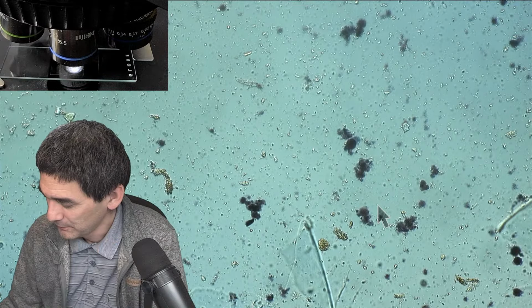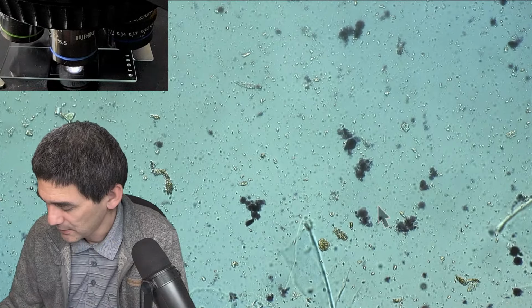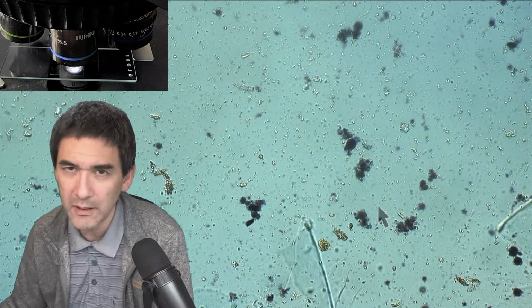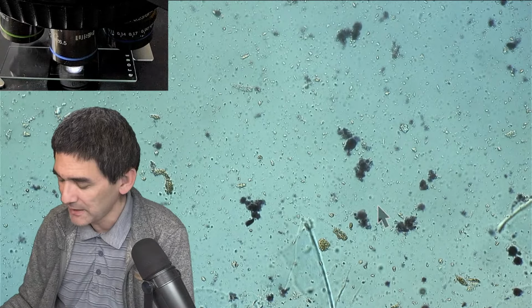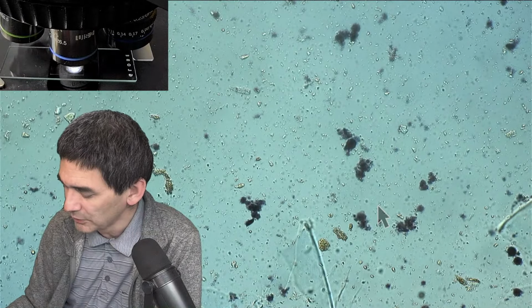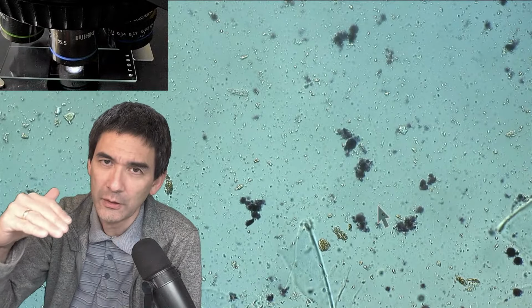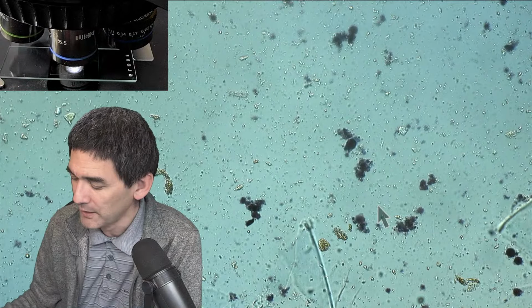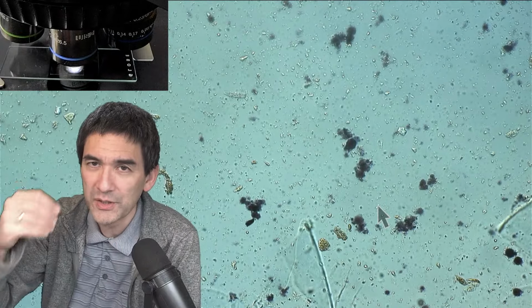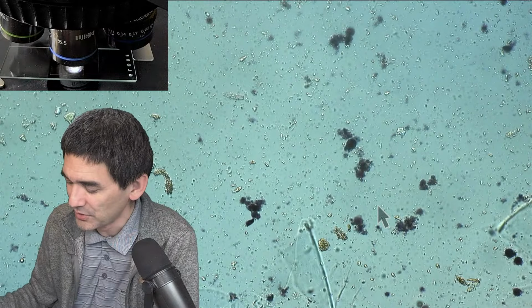Could you put some ripe fern under low magnification? Sporangia drying, I heard that they act like catapults, I think in some ferns. I need to explain this a little bit. A fern on the bottom side of the leaf has so-called sporangia, which basically make spores. And in order to propel the spores, some of them actually really eject them. Yeah, and this would be nice to see.